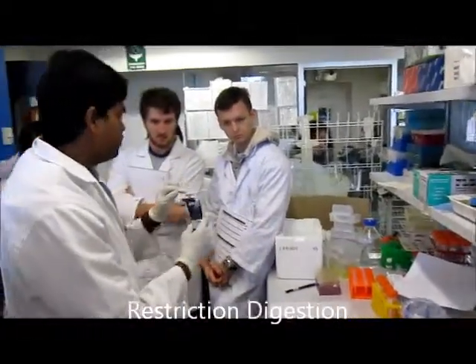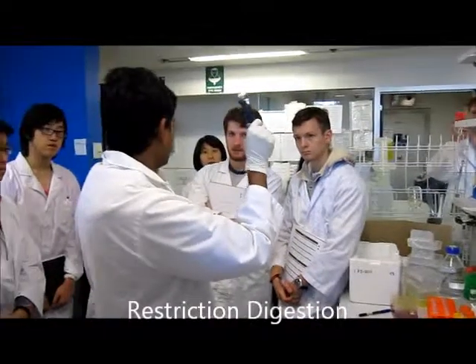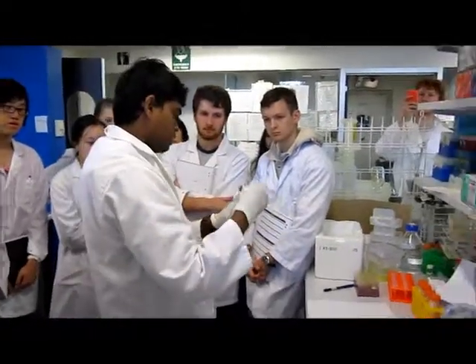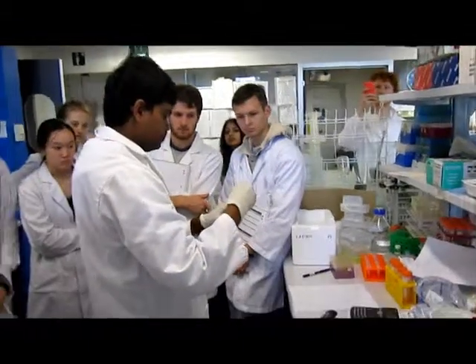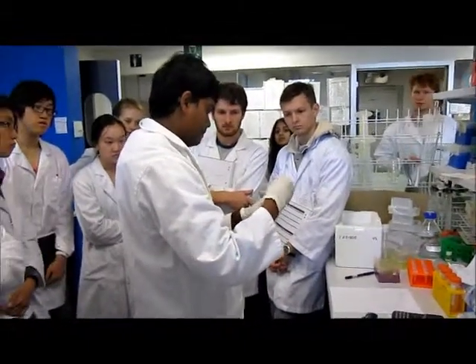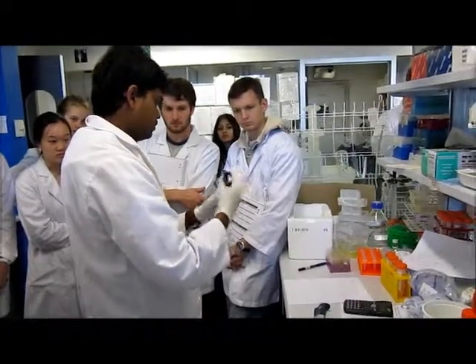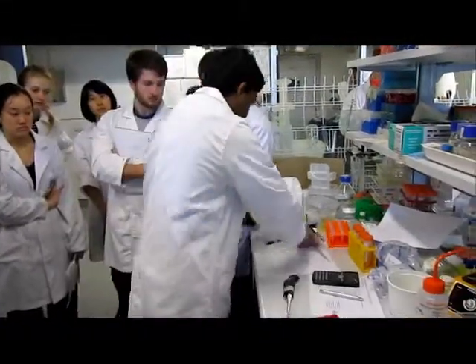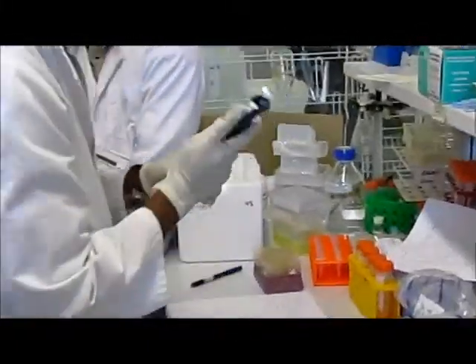This is a P20, means I can take up to 20 microliter using this pipette, okay? And now I can set 12 microliter. 12 microliter of water.